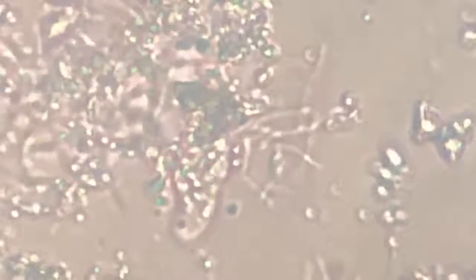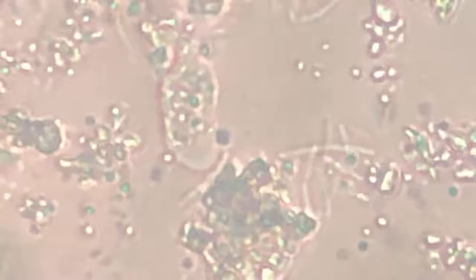I cannot see any dividing ones, sir. But since you are saying that, that must be for sure. Perhaps he's trying to grab one at the tip side. Near the tip, near the tip. Focus gone. These are really long bacteria, as big as the amoeba itself. Okay, should I go for the filter?